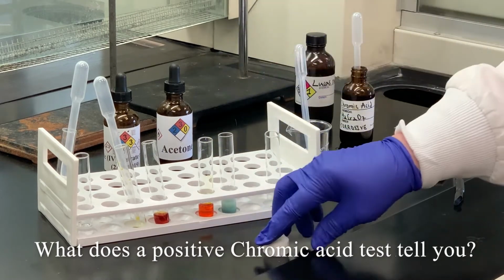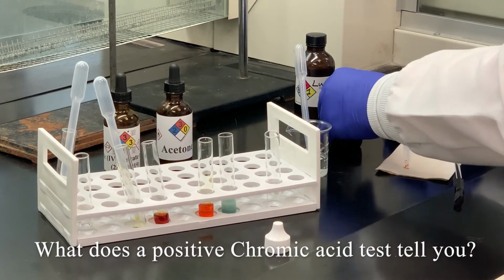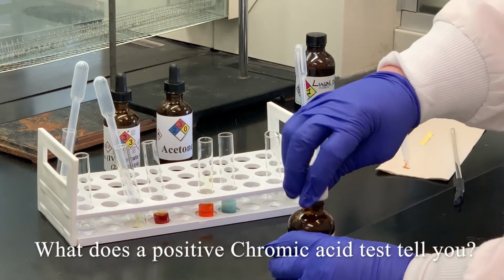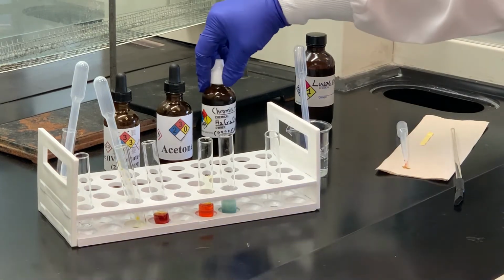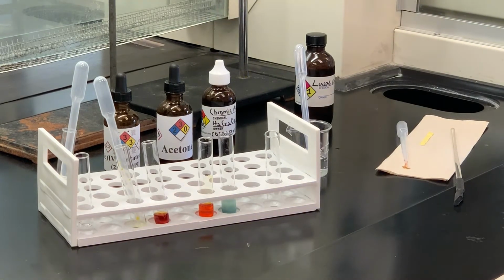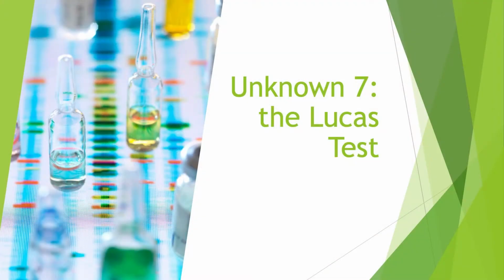So what does that tell us? If that's positive for chromic acid, then we know we had an alcohol. Well, what type of alcohol could that be? Well, if it reacted with the chromic acid, it could either be primary or secondary. So how do I distinguish between primary and secondary? That's going to give rise to the next test that we do, which is the Lucas test.